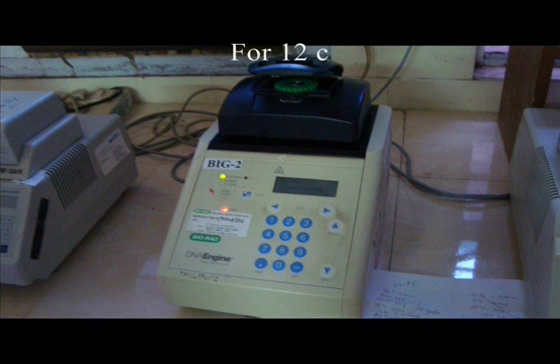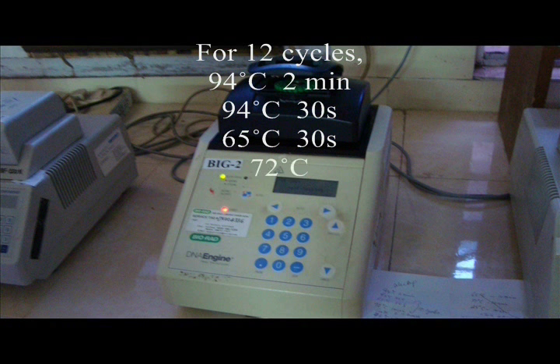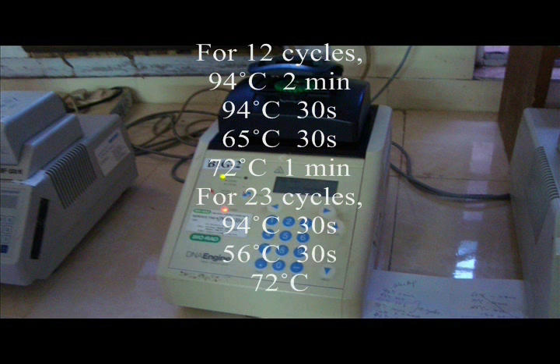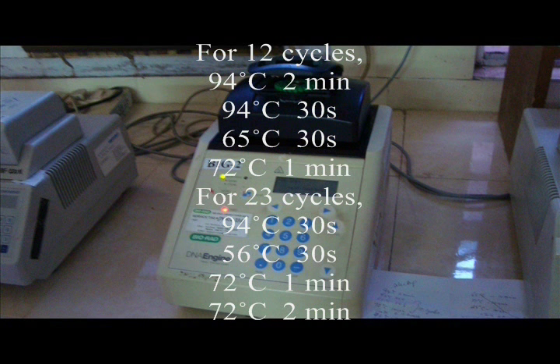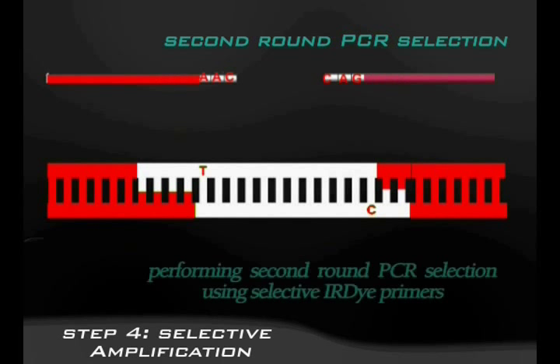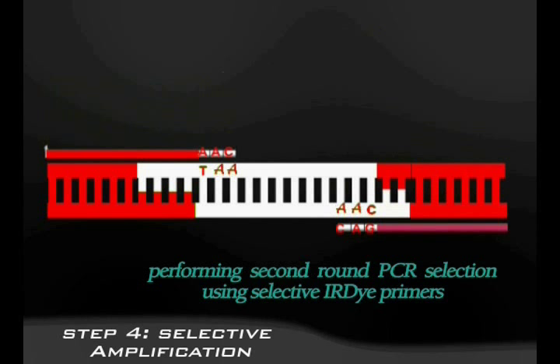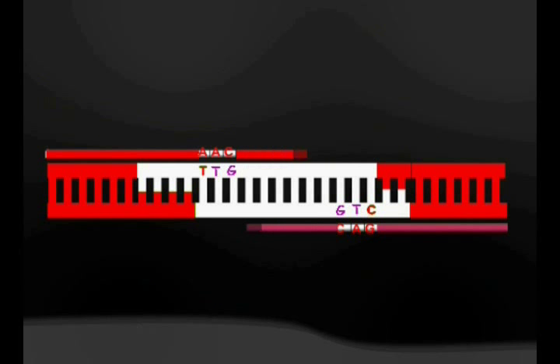The next step is selective amplification. The following temperature is maintained in the PCR machine for this process. Here, additional 3 or more nucleotides are added to the primer sequence, which makes the amplification still more selective.